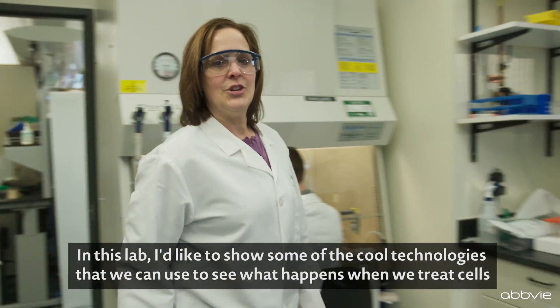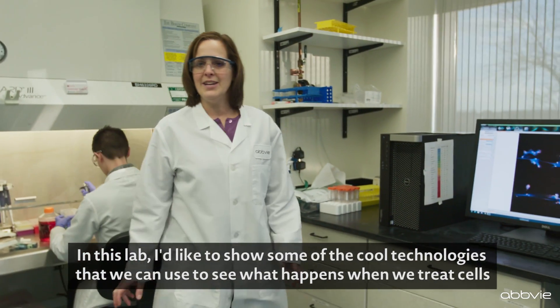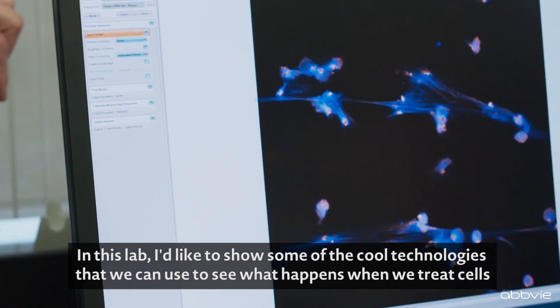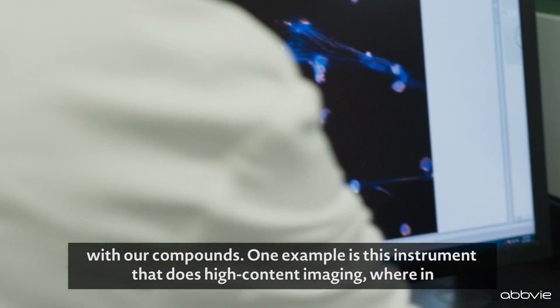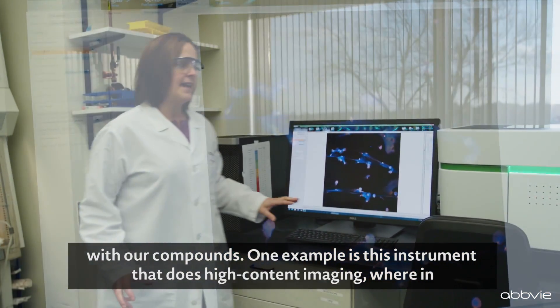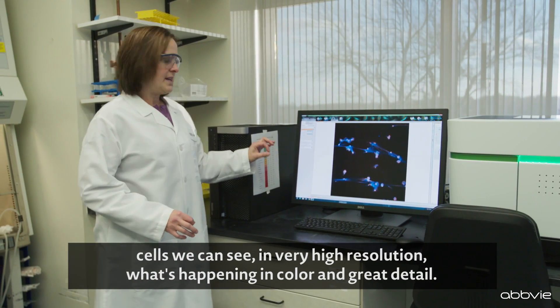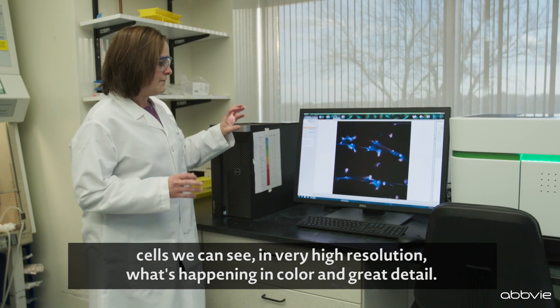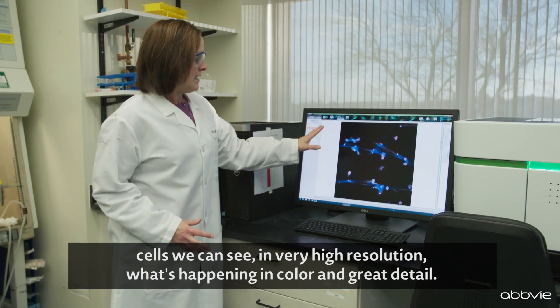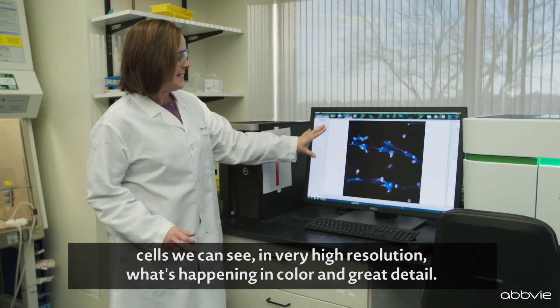In this lab, I'd like to show some of the cool technologies that we can use to see what happens when we treat cells with our compounds. One example is this instrument that does high content imaging, where in cells we can see in very high resolution what's happening in color and great detail.